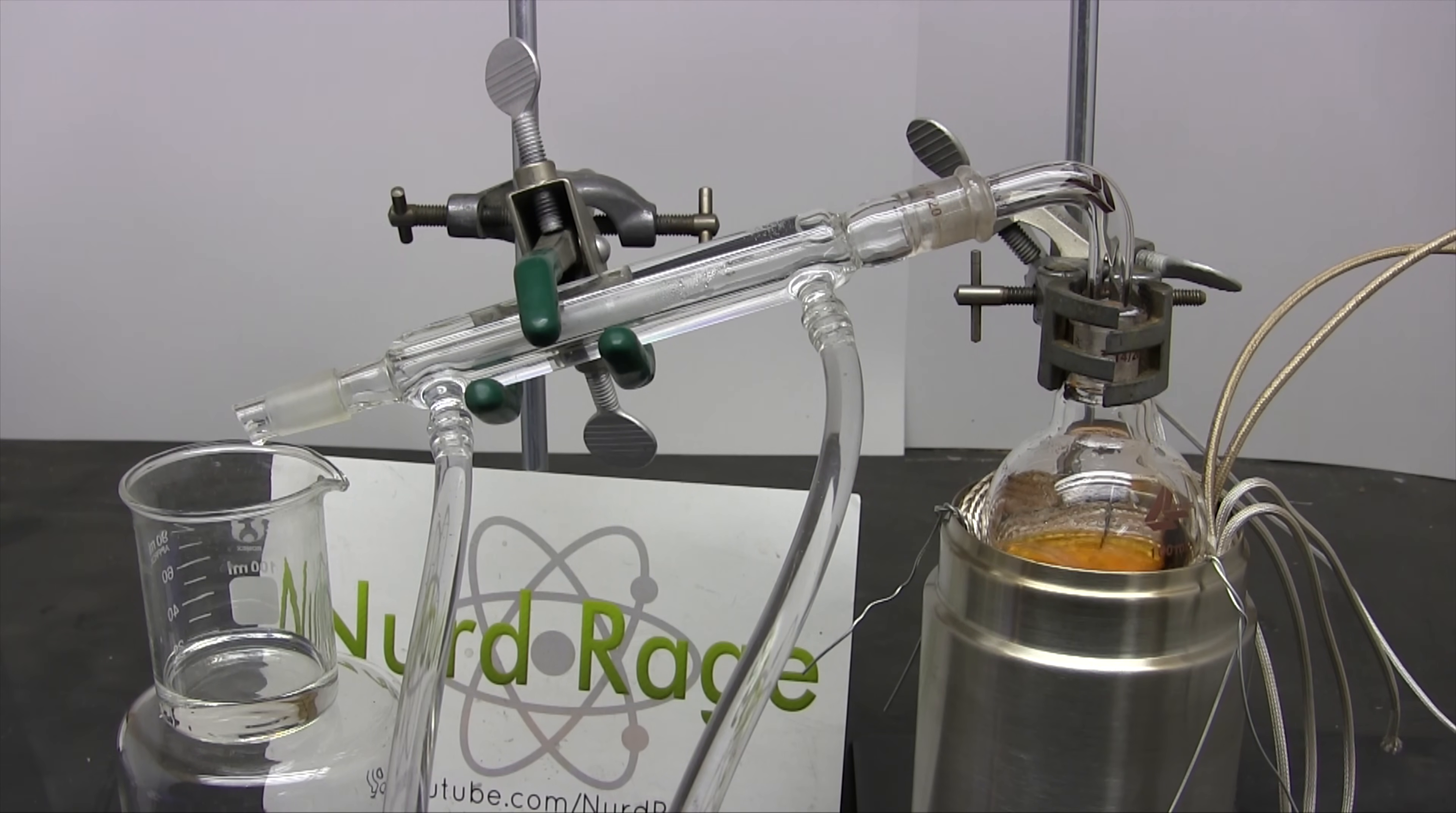Now those of you who have been with me for a while have already seen me distill sulfuric acid using a homemade high temperature heating mantle. That video is still valid and if you're already doing it that way then by all means keep doing it. But I have since improved my techniques so I am going to do it again with a few improvements here.